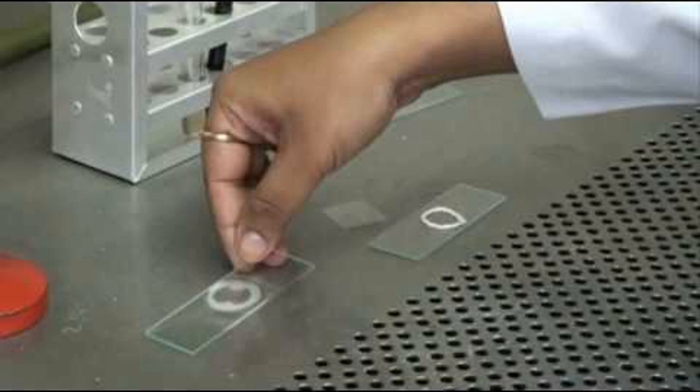Now, if we don't have a depression glass slide, we can still perform the hanging drop method with the help of some plasticine. Rest of the procedure to make the hanging drop remains the same. In this, we make a circle of plasticine and place it in the center of glass slide to create an artificial well. Then we press this slide inverted on the cover slip so that the plasticine binds the cover slip, and after immediately reversing the glass slide, we can observe the bacterial suspension under the microscope.